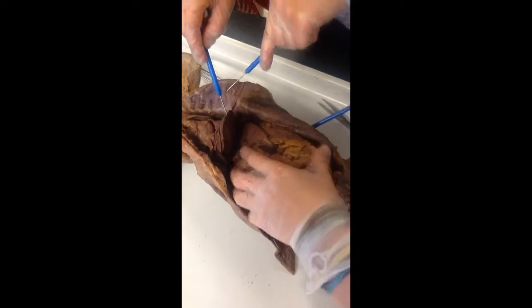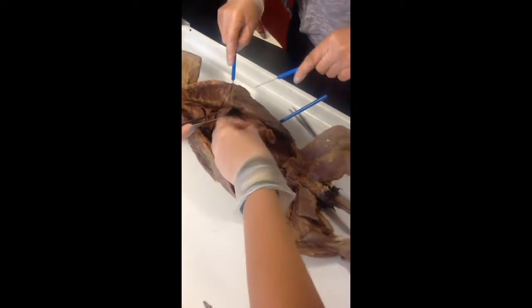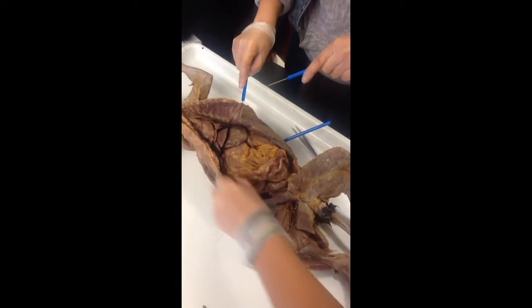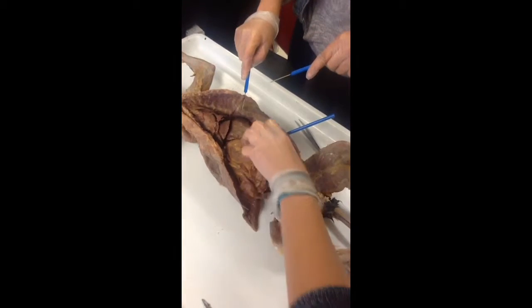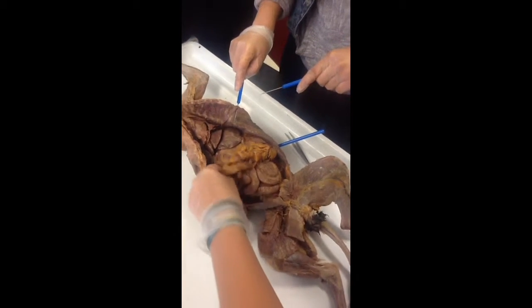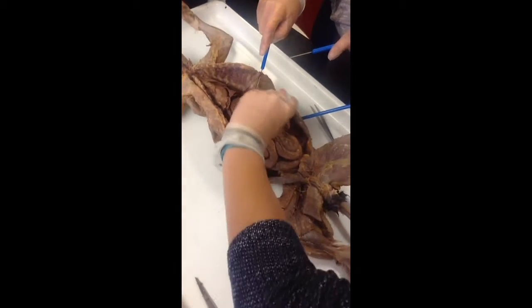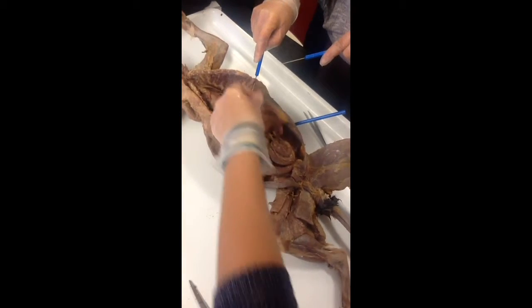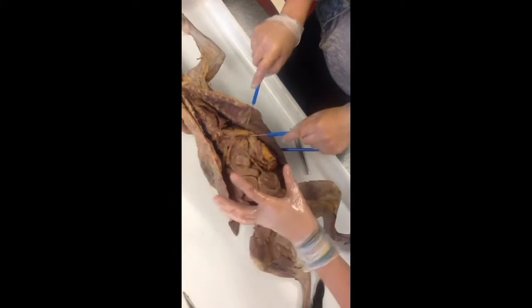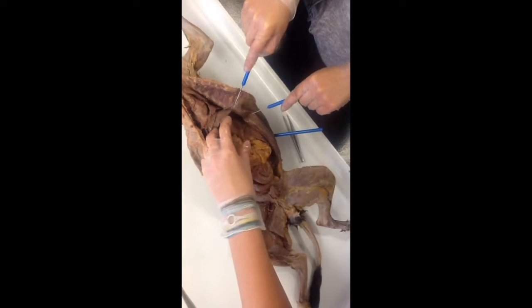It's this, right? So what I would do here, you can literally just pull this off because it's on top of this connective layer that is hiding all of your other organs. So what would this be? Is that the mesentery? It's one of the omentum layers. So which one do you think it would be, just based on the size? Greater. So this would be the greater omentum, right? That's bigger. And see how it just literally came off? It protects your small intestines. So then you've got all this stuff underneath it, but there's also the lesser omentum.